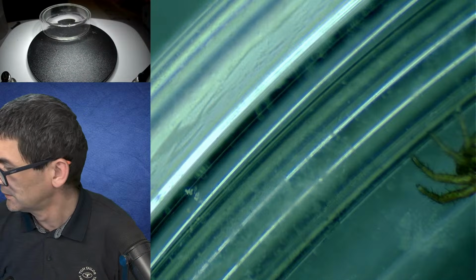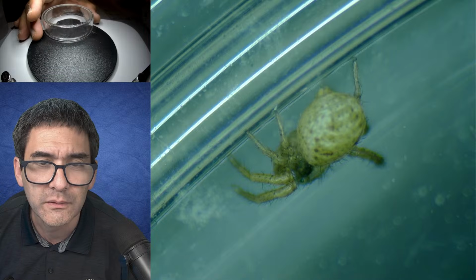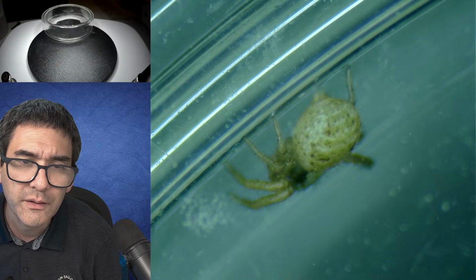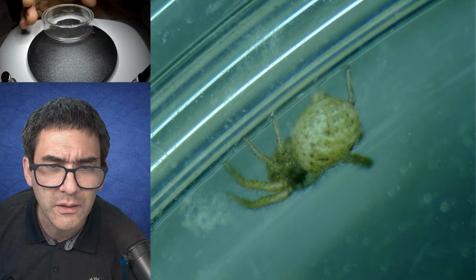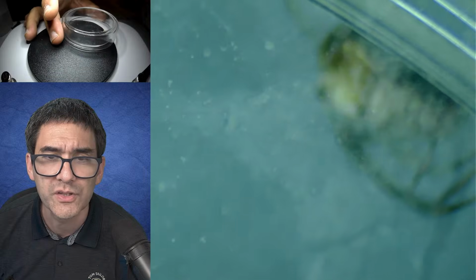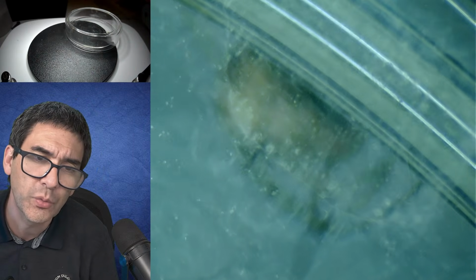Yeah, they were running around just a minute ago. Yeah, so that's the smaller one. Actually, I was hoping to see the eyes of it because, of course, spiders have lens eyes, and somewhere over here is the other one. Yeah, I've got a lid on top now so that they can't run away.